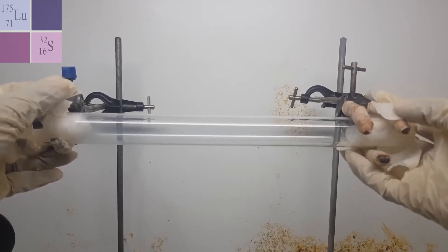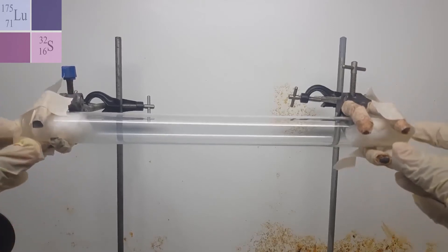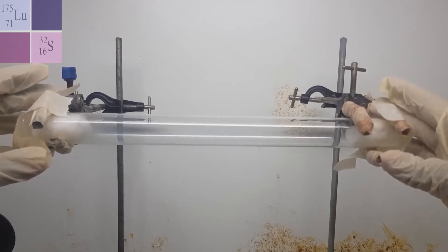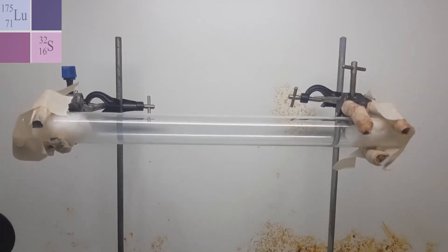This is my makeshift stopper, and I hope that my gas does not escape. So we're already seeing the HCl becoming dense white vapor. So you can see some cloudiness here. And on the other side, it's clear. So it's the hope that we will actually see when the two of them meet and form that ammonium chloride white solid, so that we could tell who was faster than who.